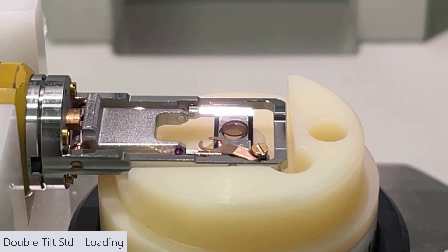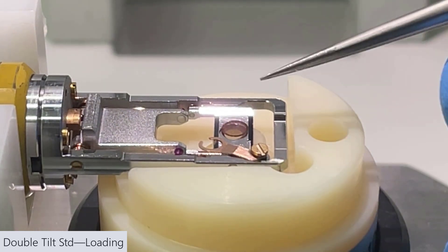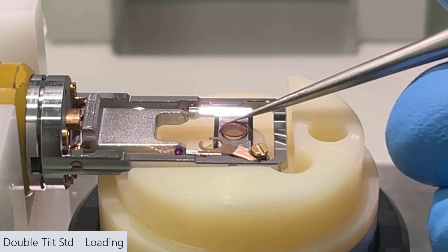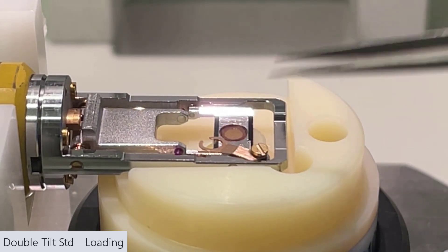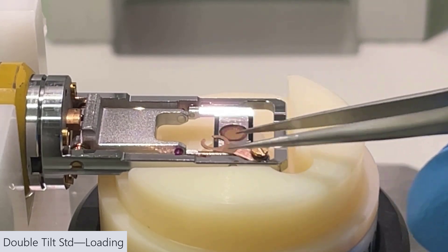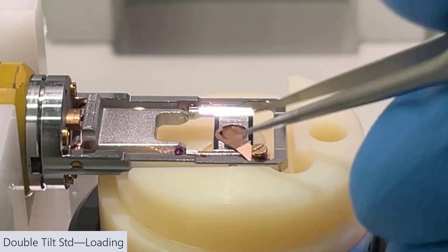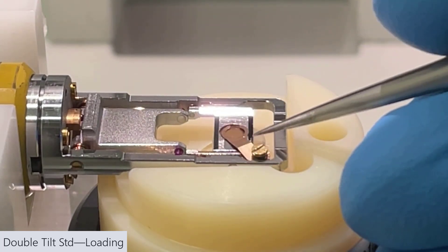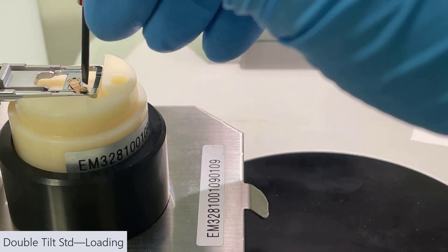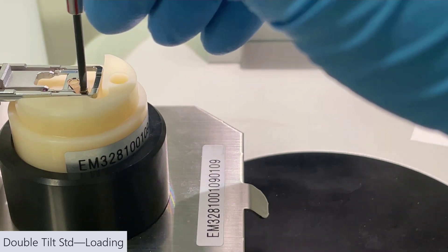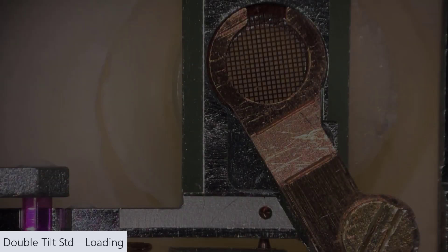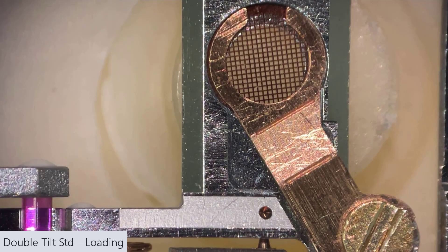Make sure it's seated properly. So here you can see it's not, so I'm just nudging it with the tweezers so that it falls into the hole nicely. Now just move the metal piece back over and also make sure that's seated properly. Then just tighten that one screw. Again, being sure not to over tighten. This is the properly seated sample.